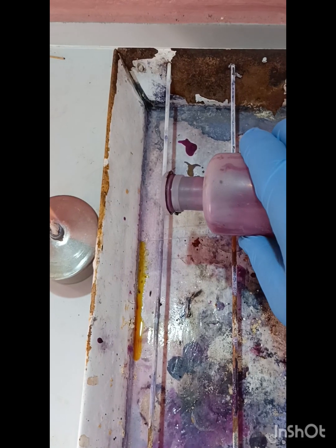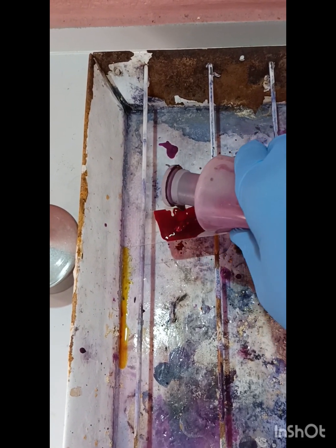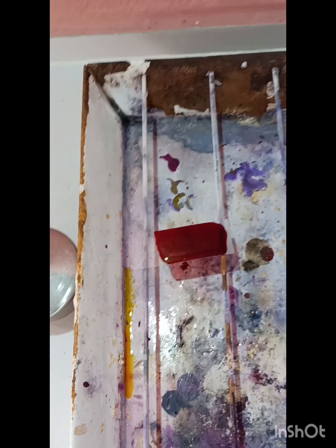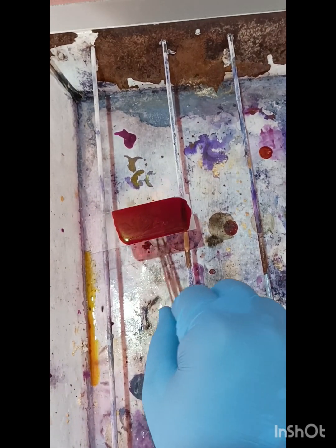First, we put carbol fuchsin over the smear, take a cotton and heat it gently.